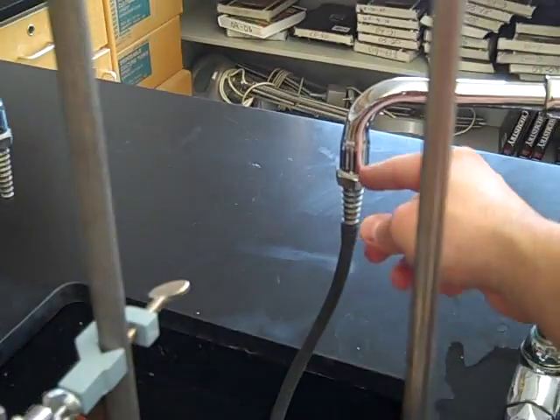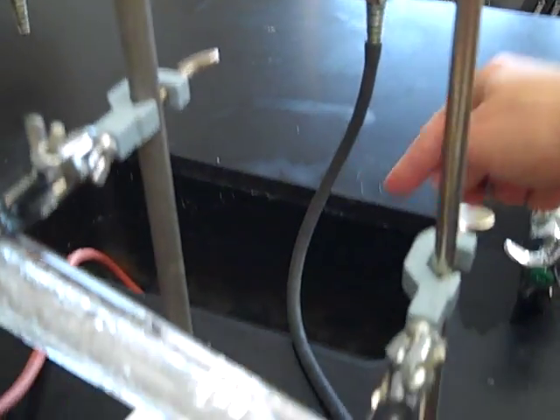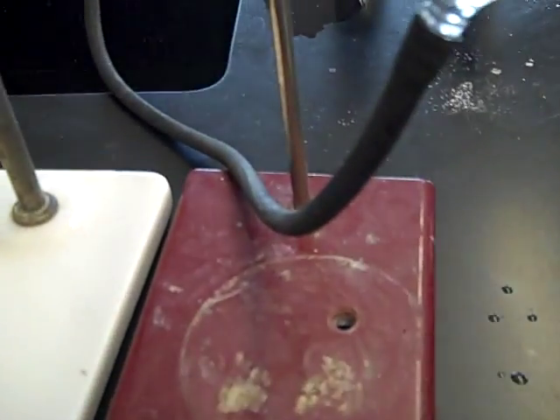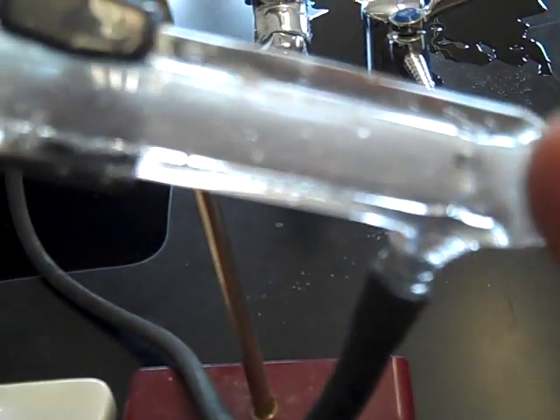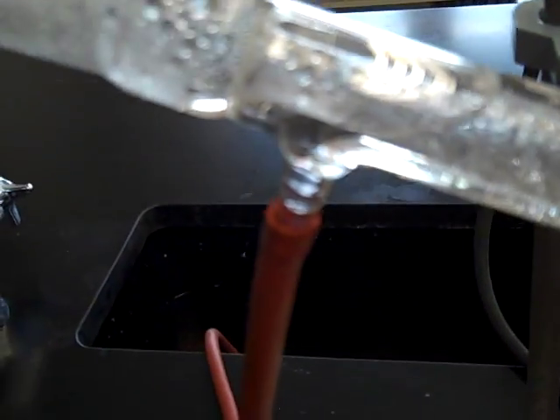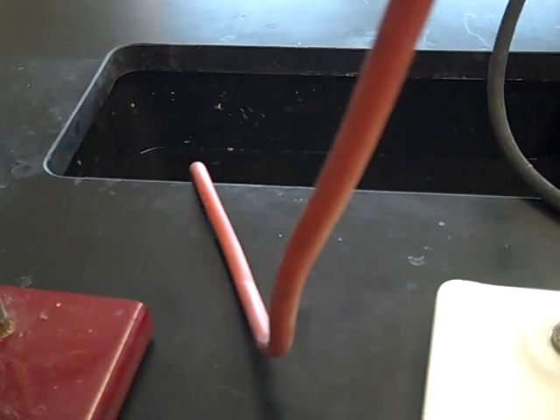Water from the faucet is running up this tube, you can follow it, the water goes right up here, and it wraps around an inner tube and exits by this pink tube. You can see that going into the sink there.